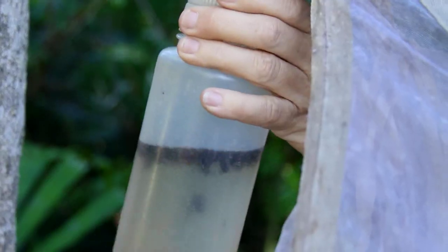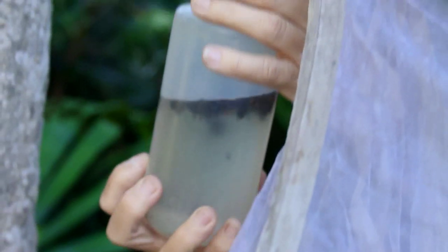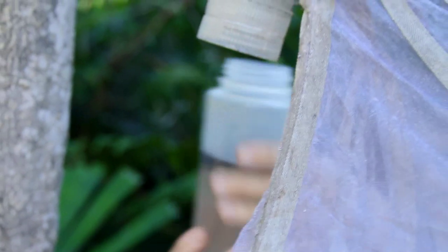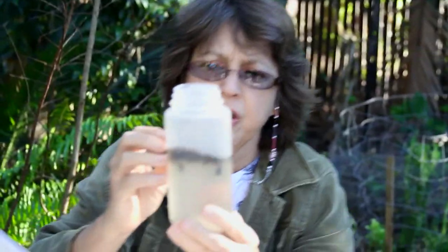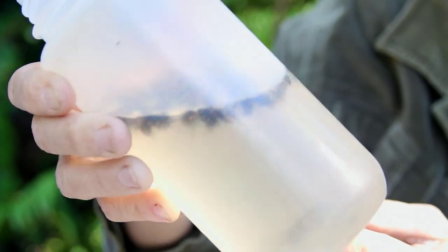After a couple of days we can take the sample. Insects have flown into the trap and have been collected in the collection chamber. Here we have a sample sitting in a preservative.